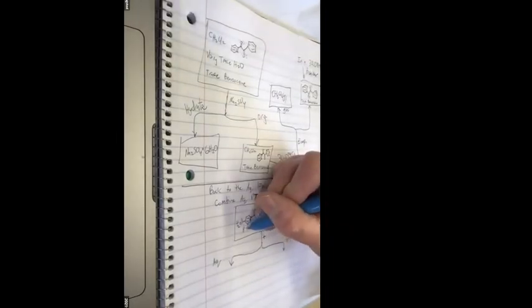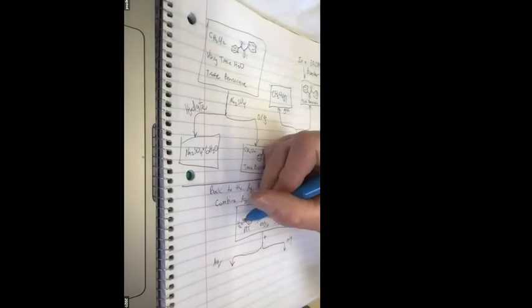I'm gonna add something to get this precipitated. Do we add sodium hydroxide again? No, because I already have hydroxide in here. What is this soluble in? It's currently not soluble in the water. I know it's a fine precipitate, but that little precipitate you see there is the benzocaine. What is this soluble in when it has no charge? Oh yeah, HCl. Well, it's soluble in aqueous HCl, but what else is it soluble in?